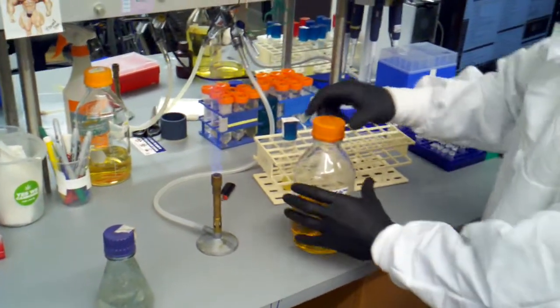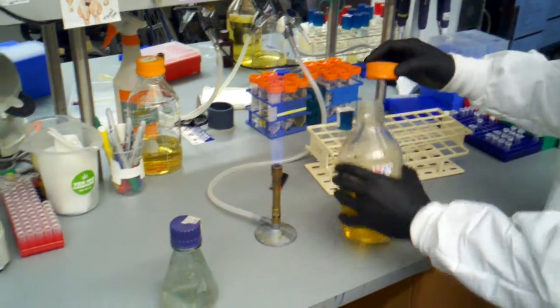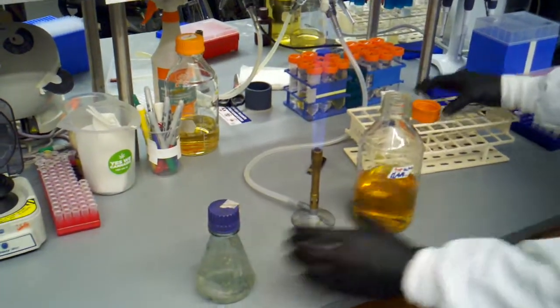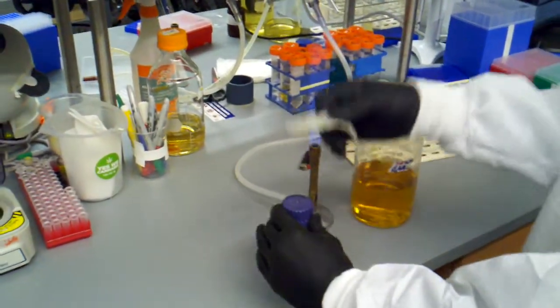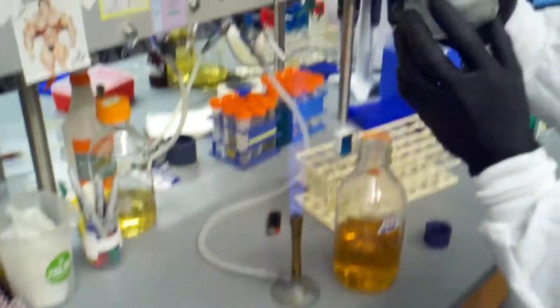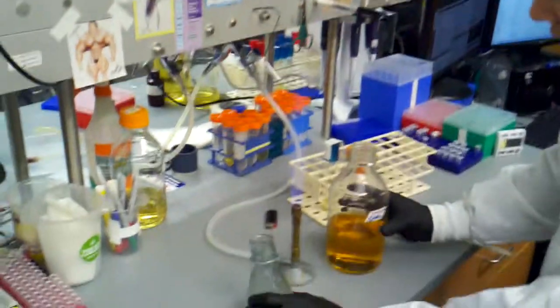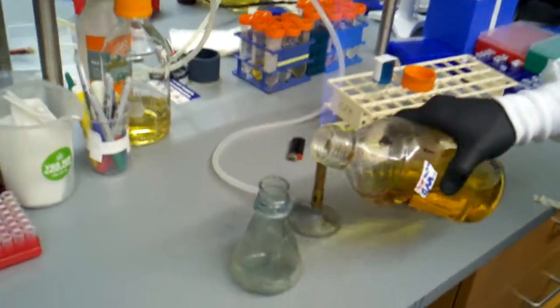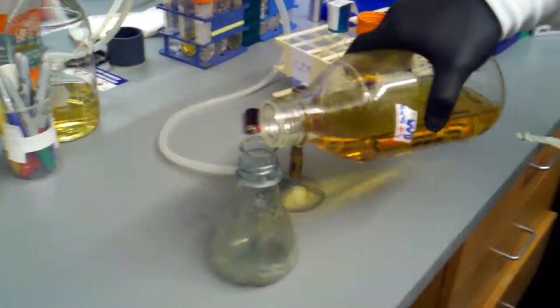So this is 2YT with chloramphenicol and ampicillin. So I'm just going to flame everything up, and I'm going to add about 50 mils to my little flask right here. There's a little 50 mil line, so I'm going to be extraordinarily accurate here.